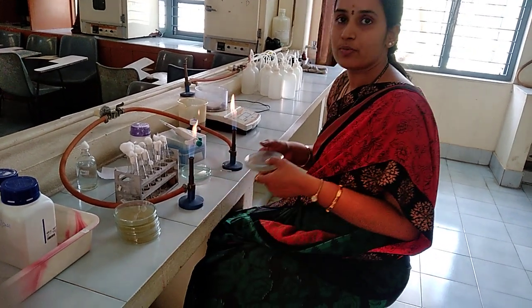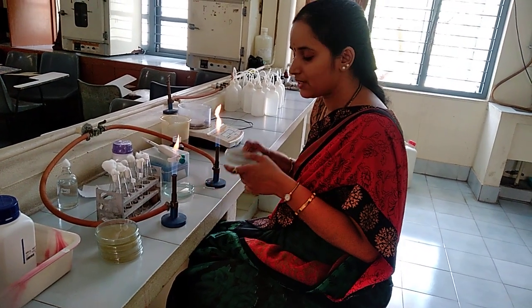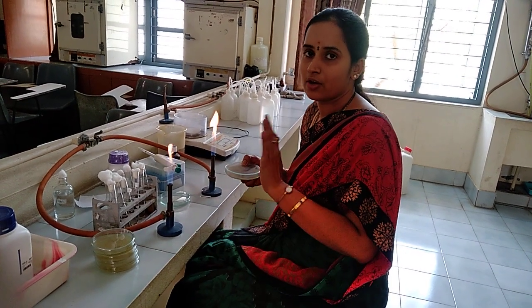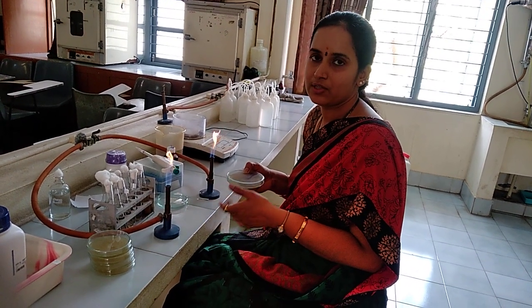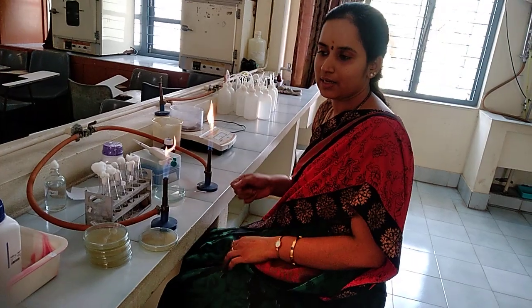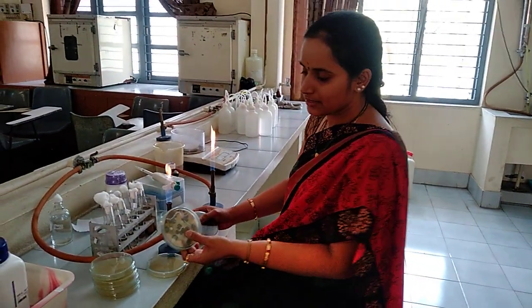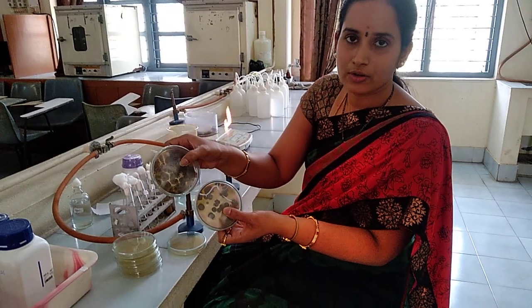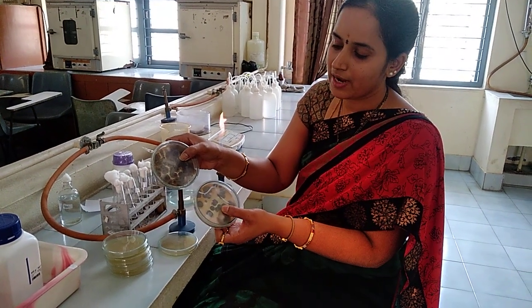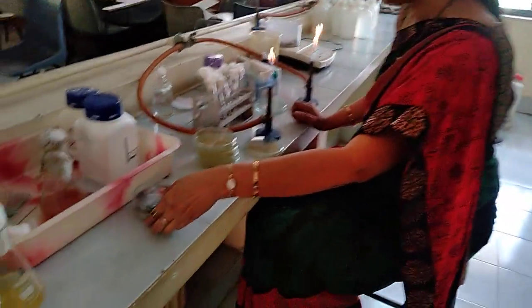This plate has to be incubated at room temperature since we are isolating fungal cultures. Not in the incubator — leave the plates outside the incubator for about 3 to 4 days and you can see the growth of the fungal cultures. This is the result you will get after incubation: you can see the cottony growth of the fungi on the medium.